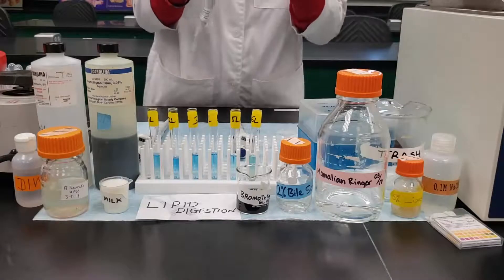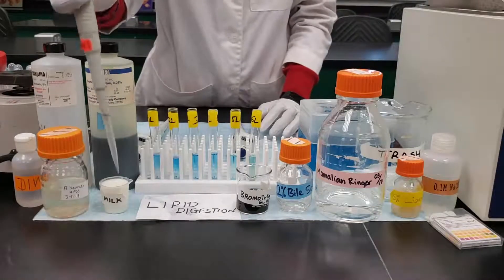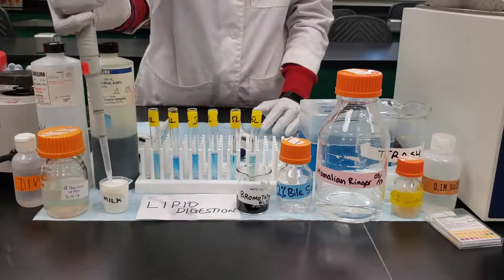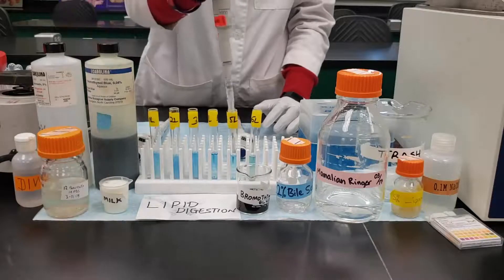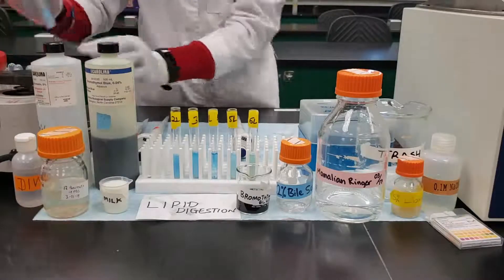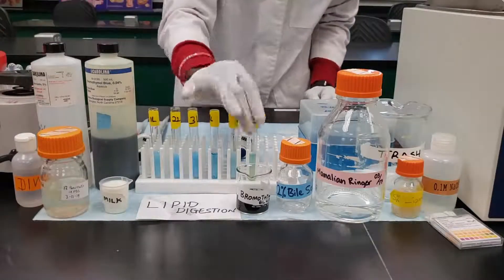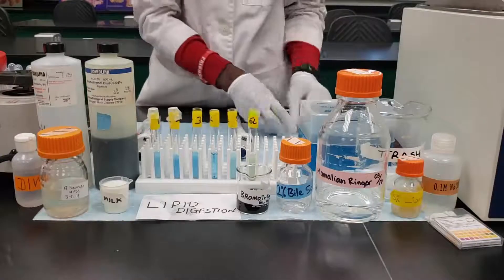The next thing is to add our substrate, the milk. Add 0.3 mL of milk to all of the tubes except tube 4. After this, mix them carefully and very well. Then use paraffin film to cover the tubes so that they don't spill when we start the incubation.